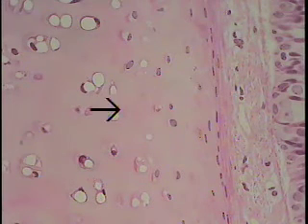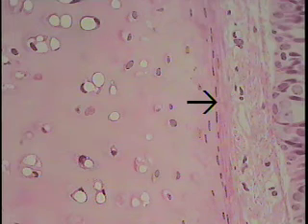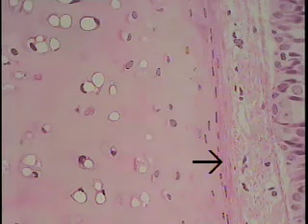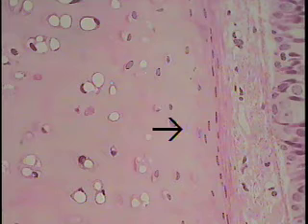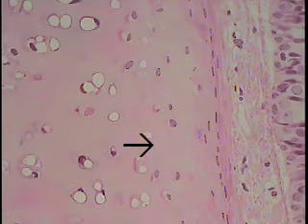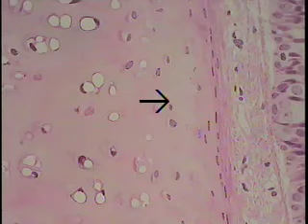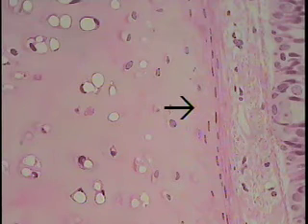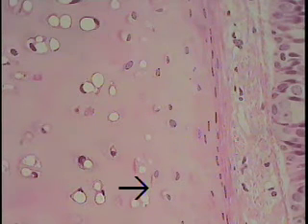This is that portion of hyaline cartilage as seen at increased magnification. This layer, from where the tip of the arrow is to about this point, is the perichondrium — a connective tissue surrounding the cartilaginous block. This homogeneous glassy type of material scattered throughout the field and traced by the arrow is the extracellular matrix. The cells identified primarily by the nuclei are the cells of cartilage, known as chondrocytes, and they reside within a little space known as lacunae.